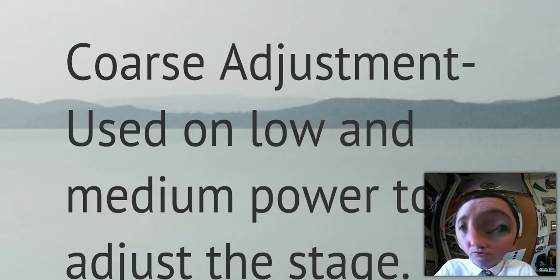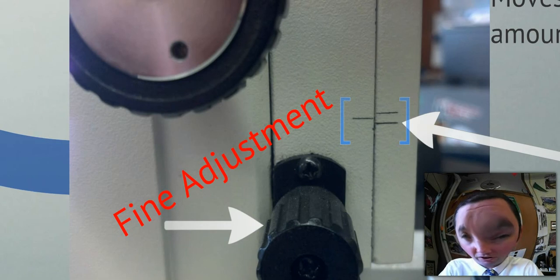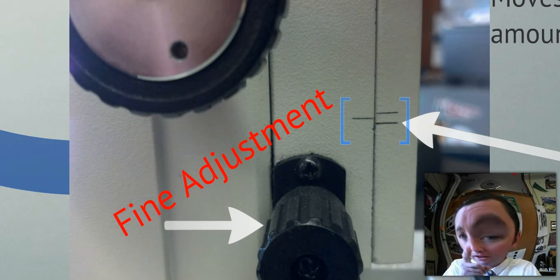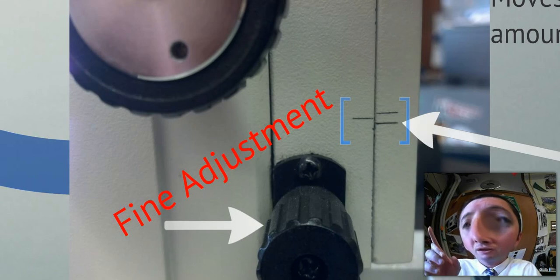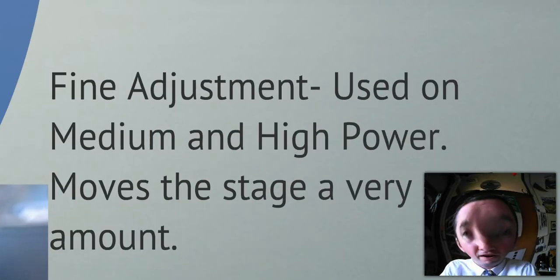We do not use the coarse adjustment on high power. It's a great way to damage the lens and destroy a slide. Now, the fine adjustment, the little tiny knob that when you turn it, it doesn't look like it's doing anything. You've got to turn this thing forever and nothing's happening. Something actually is happening. First off, the fine adjustment's used on medium power and definitely always on high power. We don't use anything but the fine adjustment on high power. So that'll be the first thing.